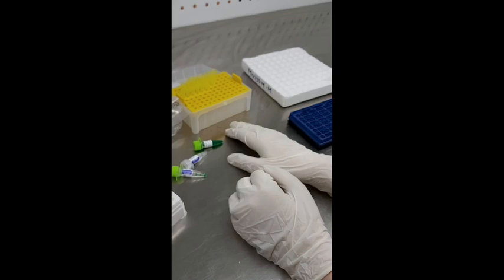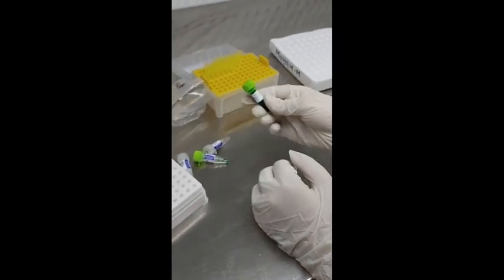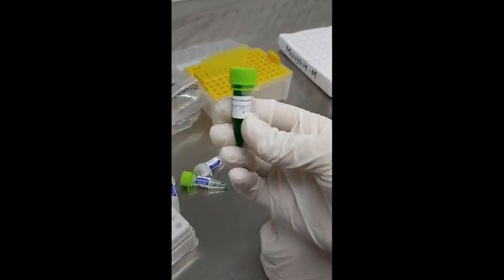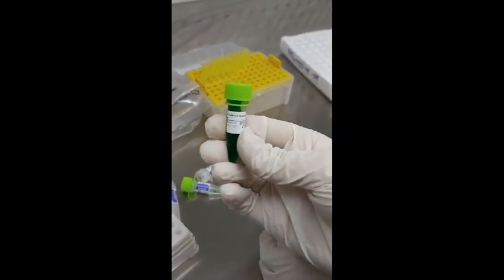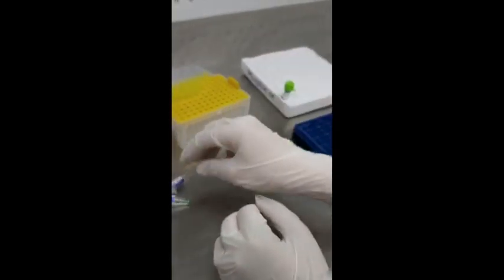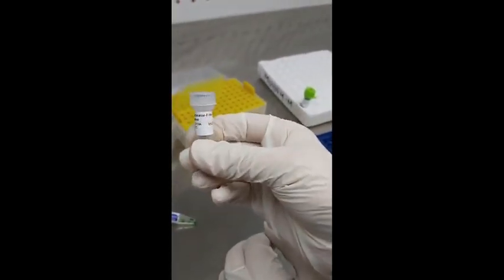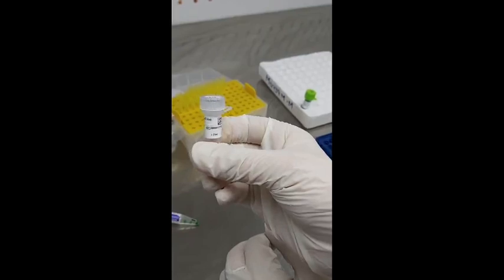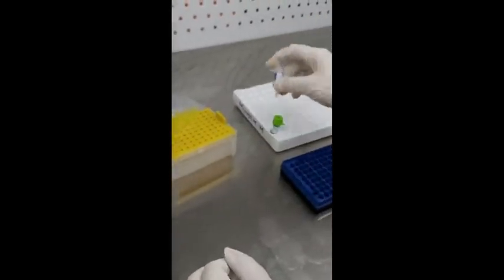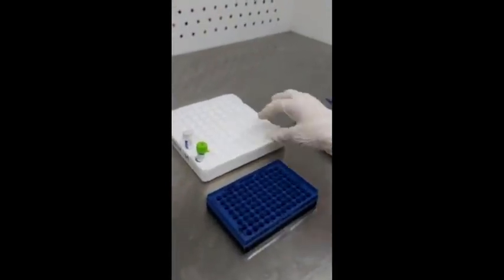The first thing you need for making the PCR reaction mixture is the master mix — this is the one we are using in our lab. The second thing you need is nuclease-free water. So these are the first two things needed for making the PCR reaction mixture.